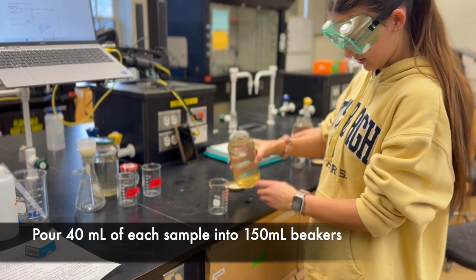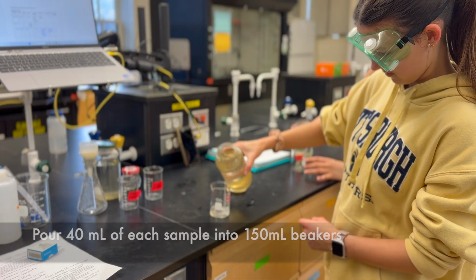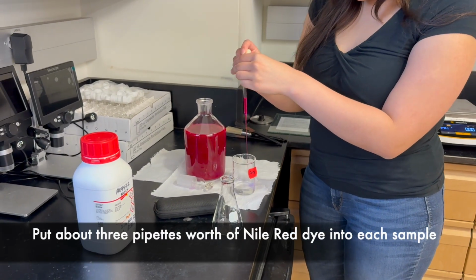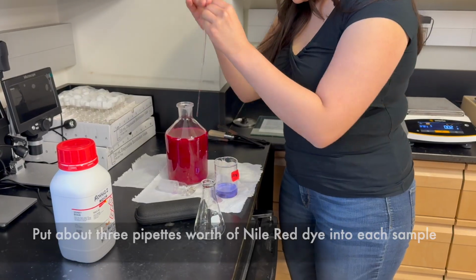First, we poured 40 milliliters of each sample into 150 milliliter beakers. Next, we put about 3 pipettes worth of Nile red dye into each sample.